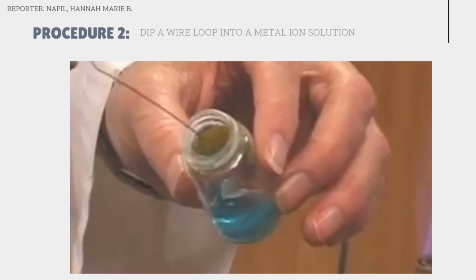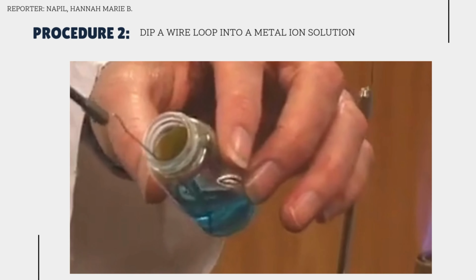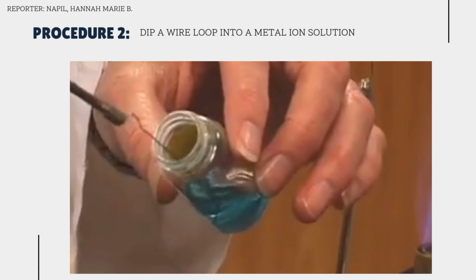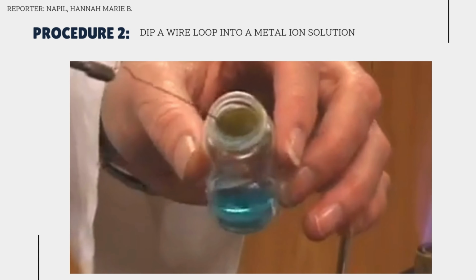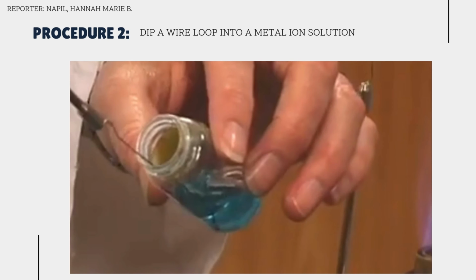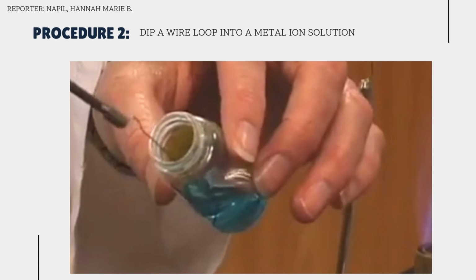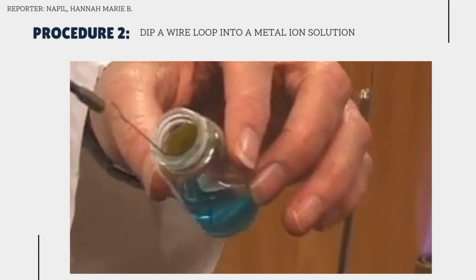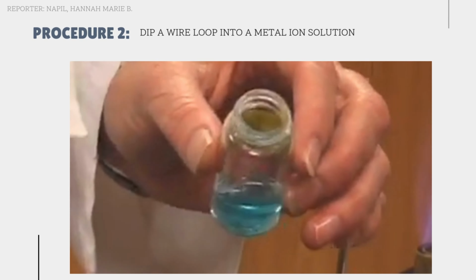Procedure 2. Dip a wire loop into a metal ion solution. Dipping a wire loop into a metal ion solution is a necessary step in flame testing because it allows us to transfer a small sample of the solution onto the wire, which is then introduced to a flame to excite the metal ions and produce characteristic colors.